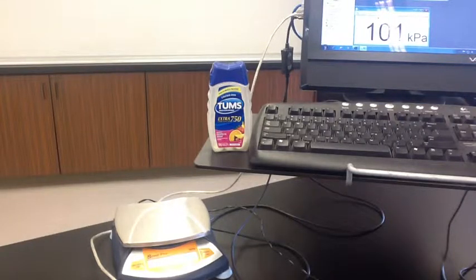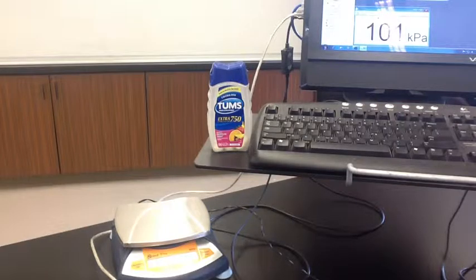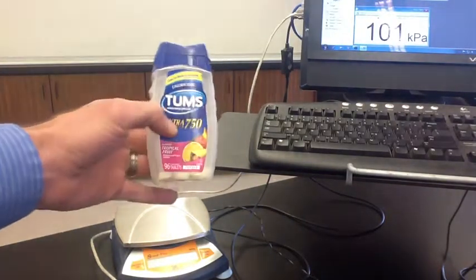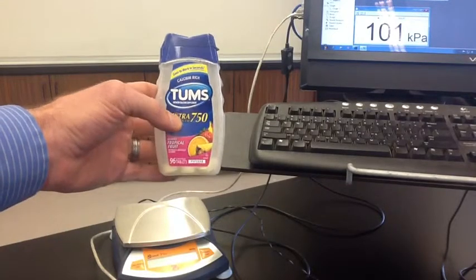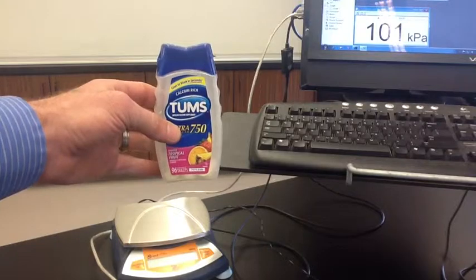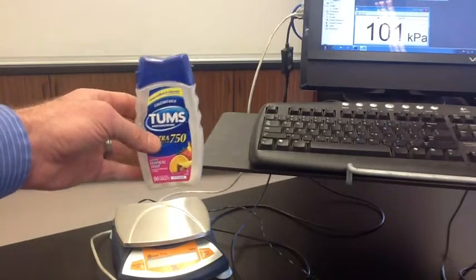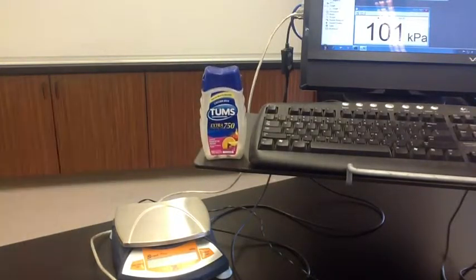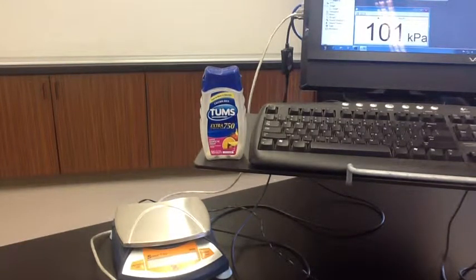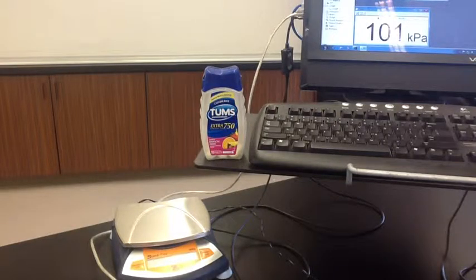In this lab, we're going to be finding the calcium carbonate content in some antacid tablets. These are Tums brand, and they contain a chemical called calcium carbonate. Calcium carbonate reacts with excess hydrochloric acid in the stomach — it neutralizes that acid. During that neutralization reaction, carbon dioxide is produced. By measuring the amount of carbon dioxide produced, we can calculate how much calcium carbonate was in the original Tums.